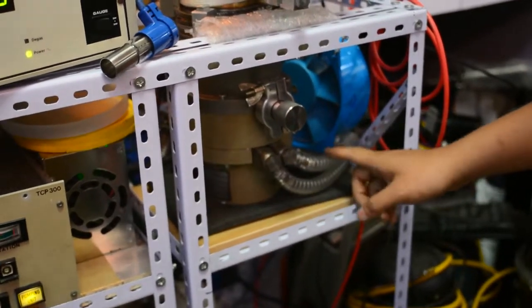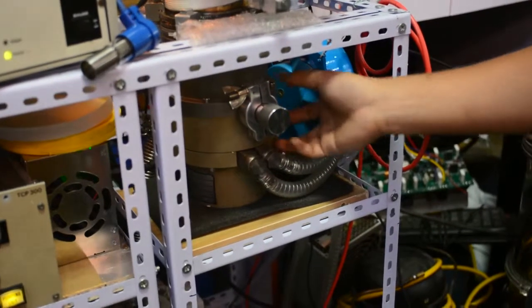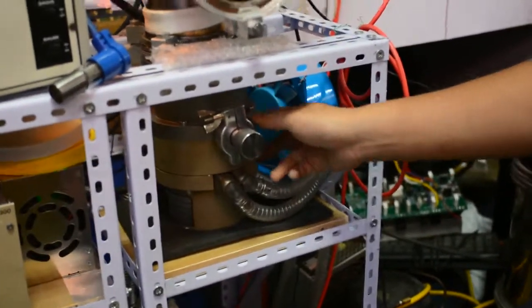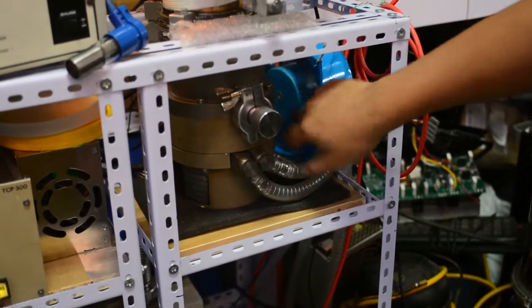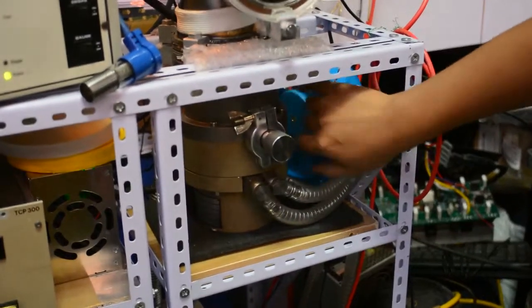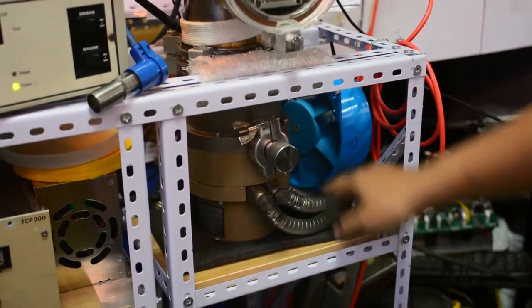If it is rising up the temperature, I will maybe turn on this bloody thing. It is making a lot of noise. I hate them.